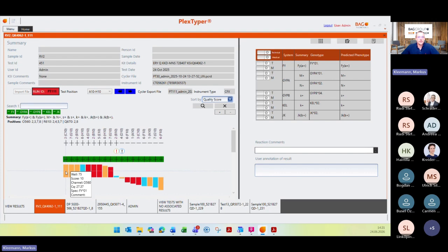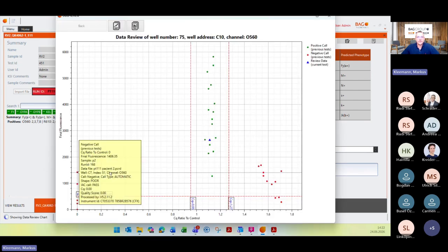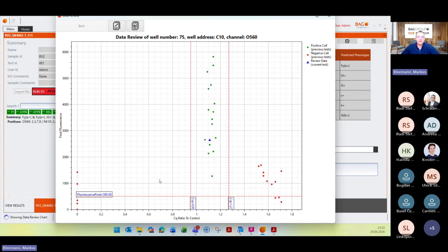When you go with the mouse over these bars, you can see the well position, the quality score, and also the specimen of this reaction. So it switches when I move here, for example, and so on. And when I double click on this bar, for example, so we start with this quality score 10, a really good positive reaction, you can see here this data review chart.